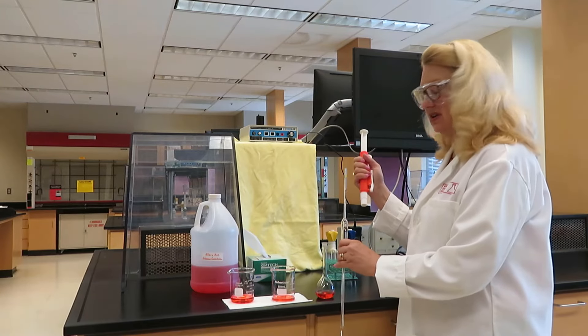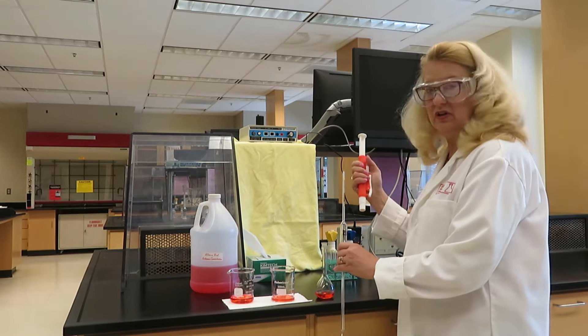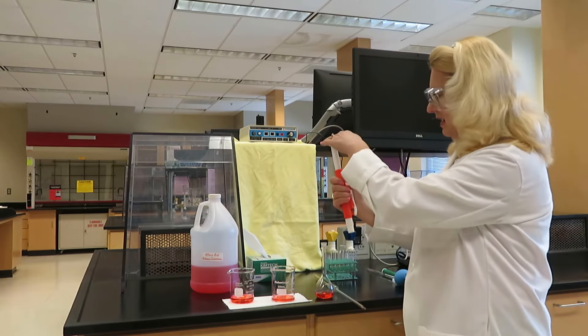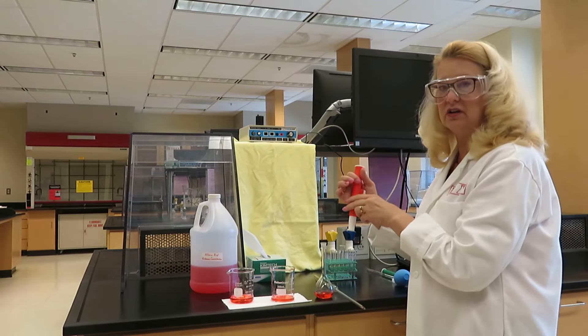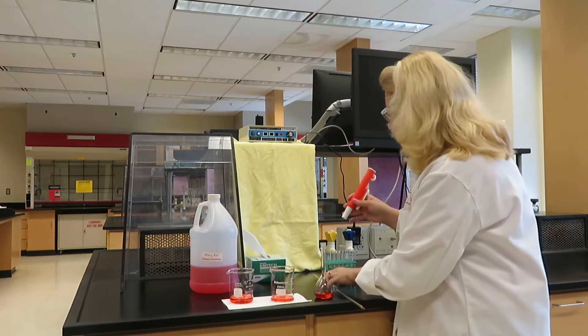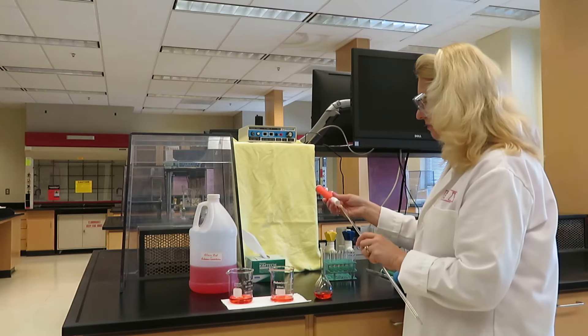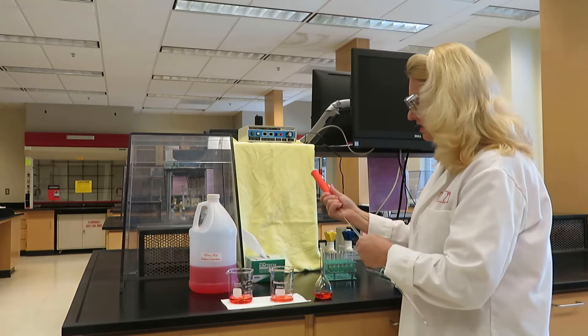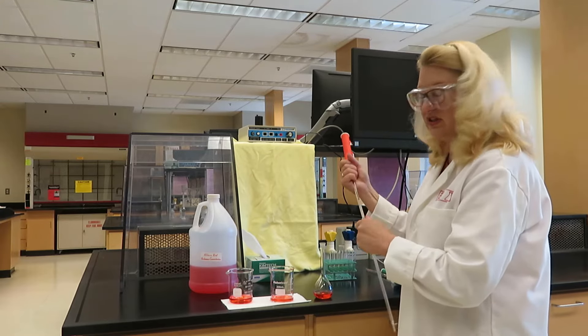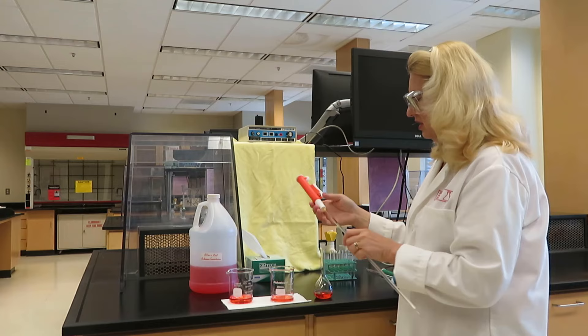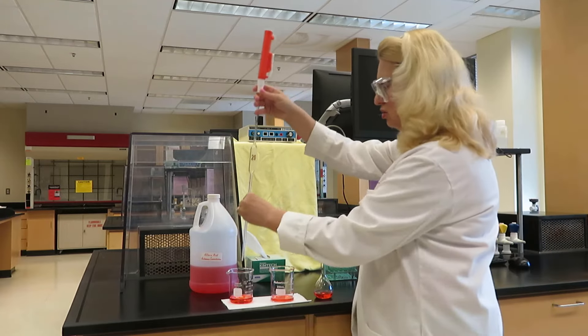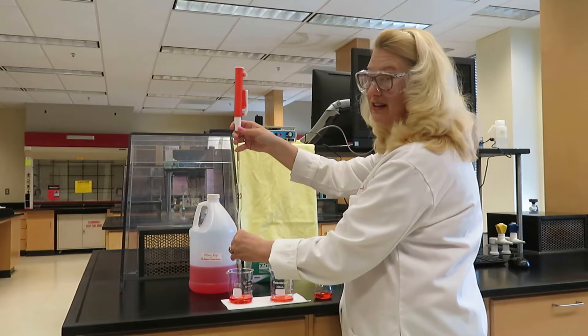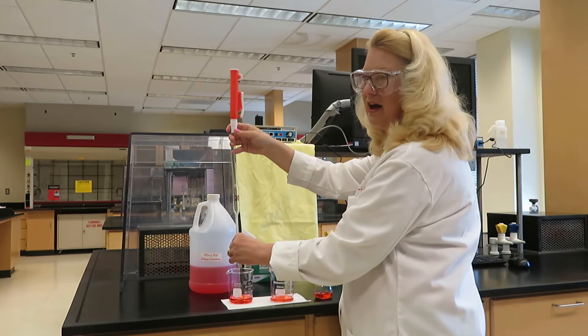Now of course, if you need to do another 20 milliliters for a different solution, you're going to have to reset your pipette by pressing down the plunger. Also, when you're putting the pipette filler onto your pipette, if you're going to exert a lot of pressure in order to put it on the end, try not to do it when it's in the solution. You don't want to accidentally put in too much force and knock it over.